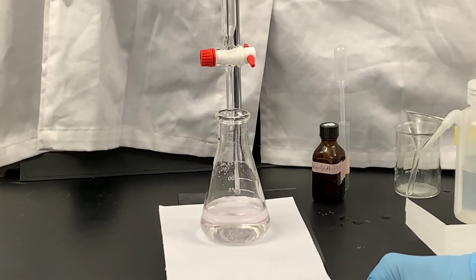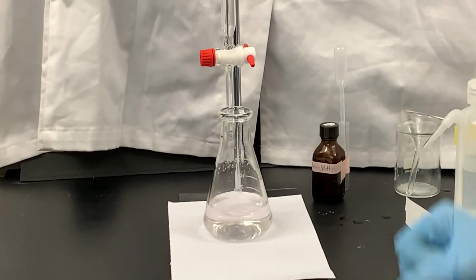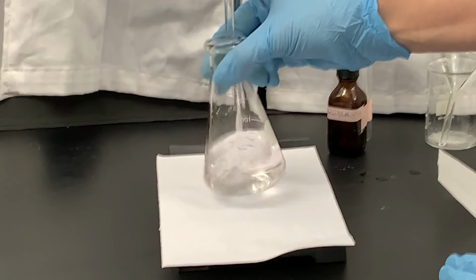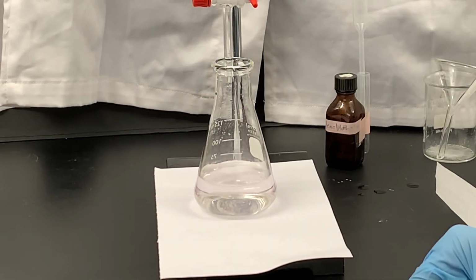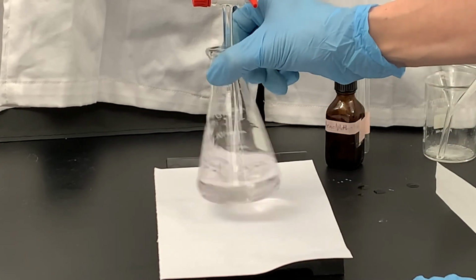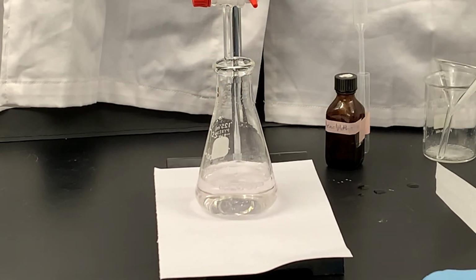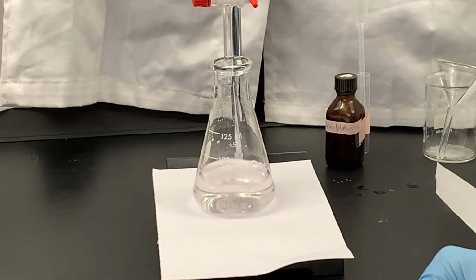That looks like it. Look at how beautiful that is. Barely, barely pink. If I keep swirling this, it is going to absorb carbon dioxide from the atmosphere, which is acidic, which will make the color go back to colorless eventually. But it's pink right now, and it's such a light pink. I like to say your titration should be such a light colored pink that you should ask for a second opinion to make sure it actually is a light pink color.